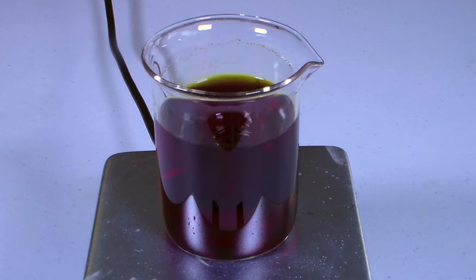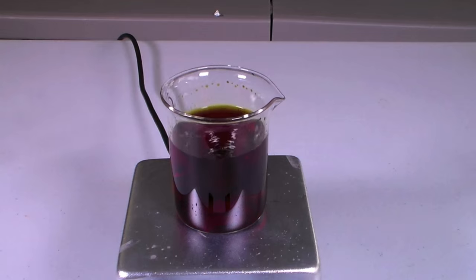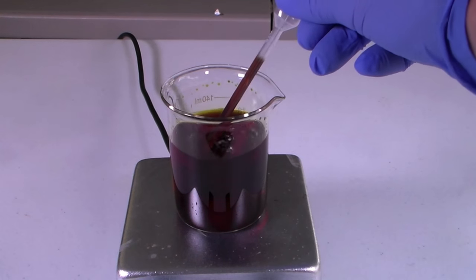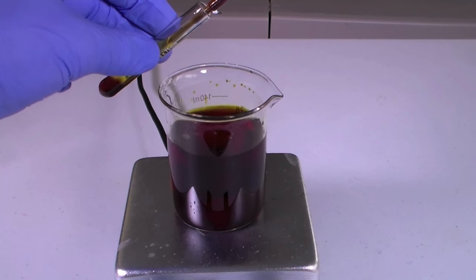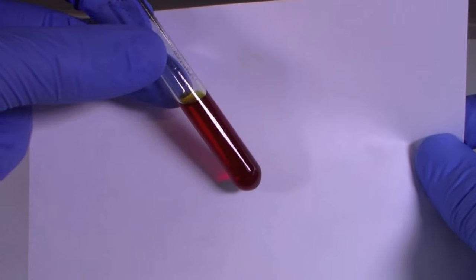Once all of the powder has dissolved you can see it makes a nice red solution. To make the color even more apparent I have added some of the solution to a small test tube and placed it in front of a white background.